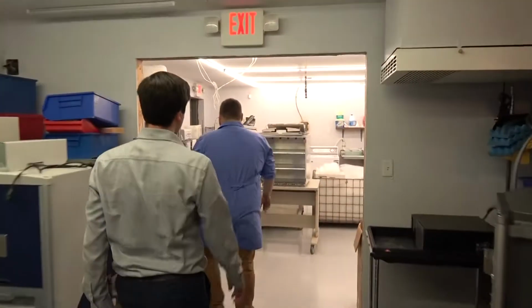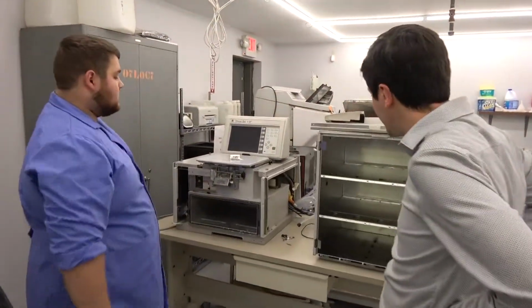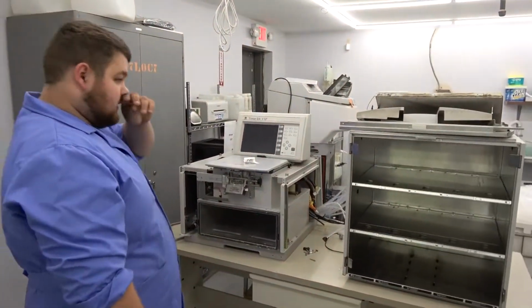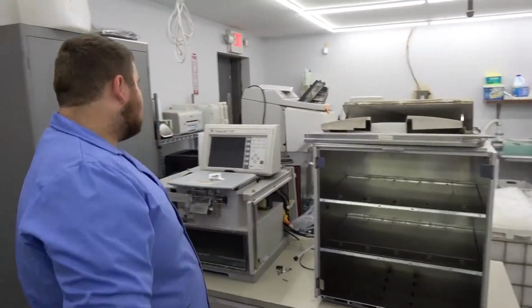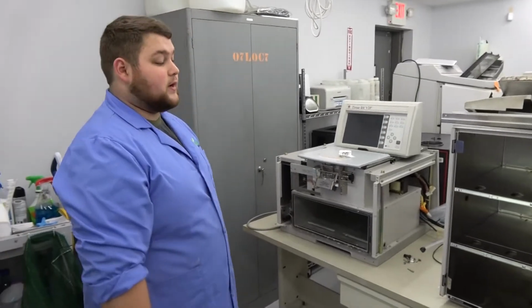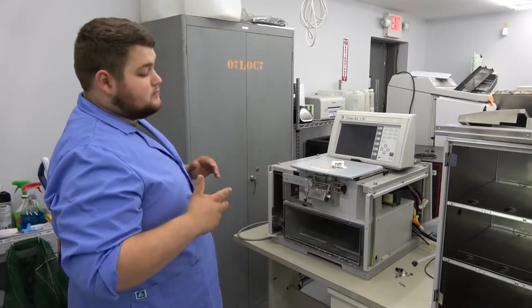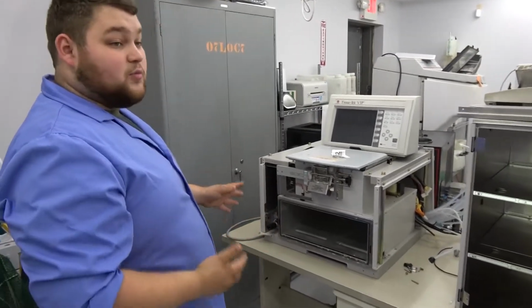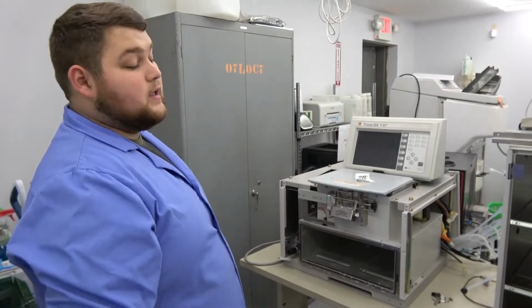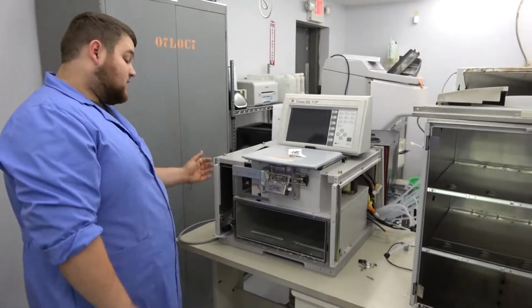So we originally got that stand-up unit in. Like you had said, it had a pungent odor to it and some dented up panels. So to put our best foot forward, we bought a parts unit, which is this right here, that we then stripped down and took every available good or better part than what was on the other one and put it all on that. So it got all the really nice panels from this.